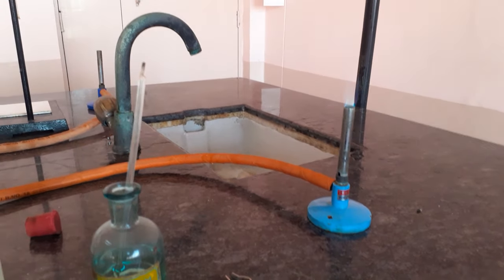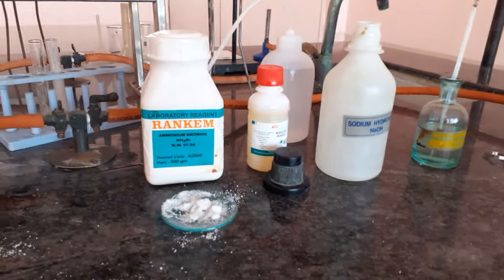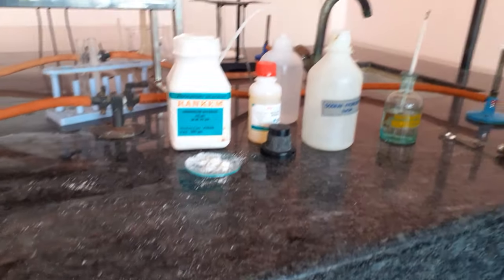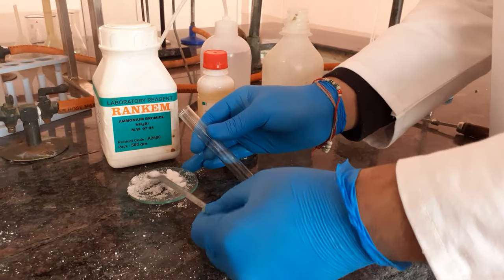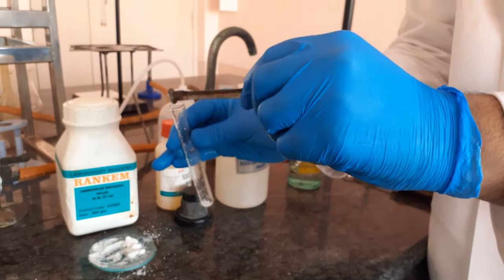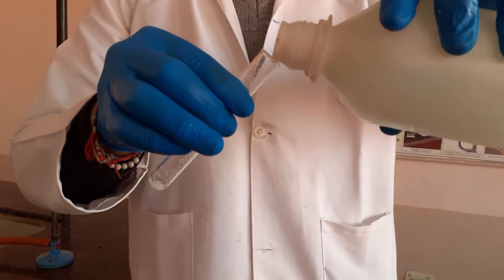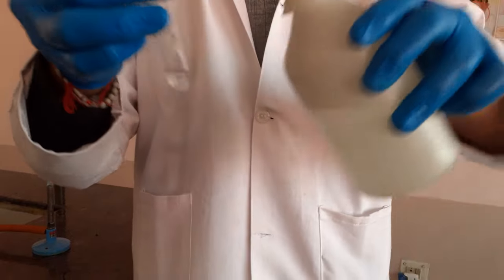We are in the month of January and the gas evolution in the case of ammonia is slightly tough. My student Cheyenne is now going to take a pinch of salt in a test tube and will add sodium hydroxide to it. We will try to observe if there is any gas evolution.